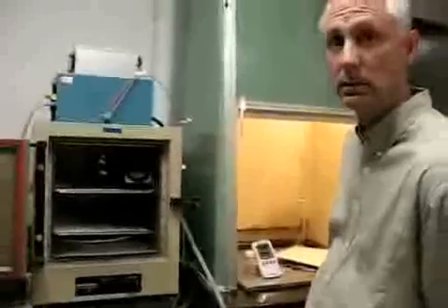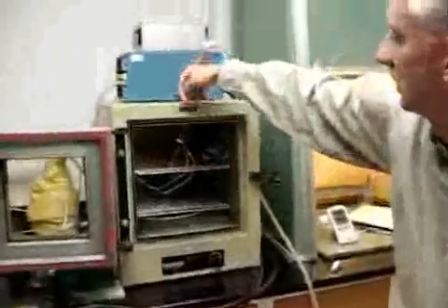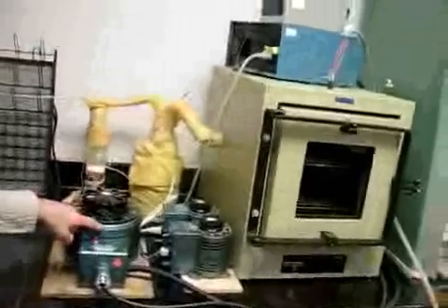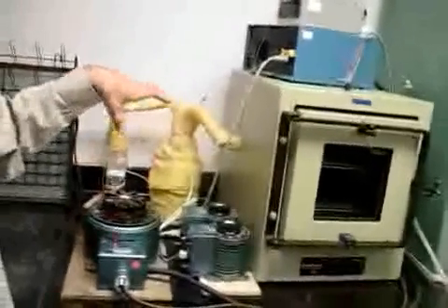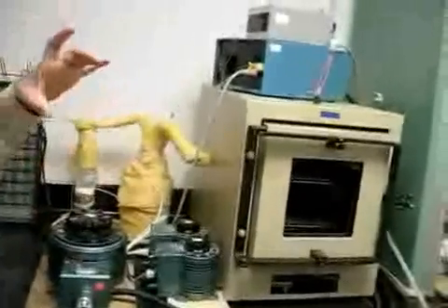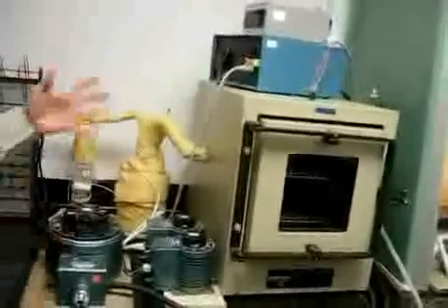Can you touch on the temperature controls for me, please? Yes, the temperature controls. We have several thermocouples routed into the furnace. Some of them are only for monitoring the temperature. Some of them are temperature feedback control. And actually, the temperature of the oven is not a temperature feedback, correct? Right. It is a voltage that has been determined empirically under these conditions that we set on this variac, and we've observed that it maintains this 4 degree C span at this setting, at these conditions.